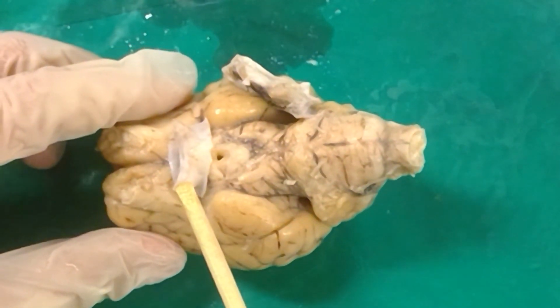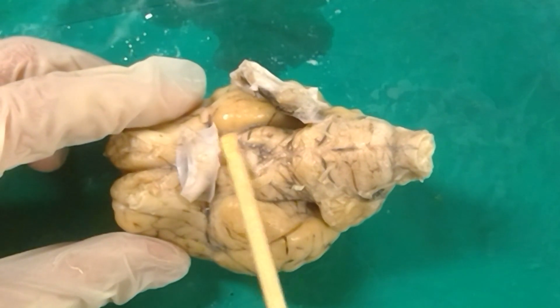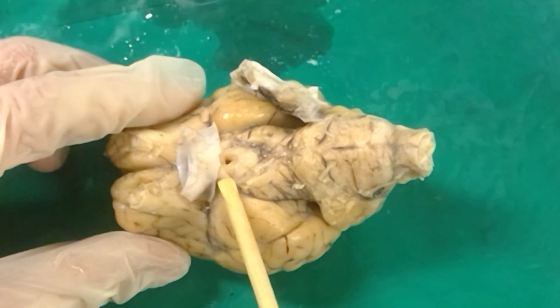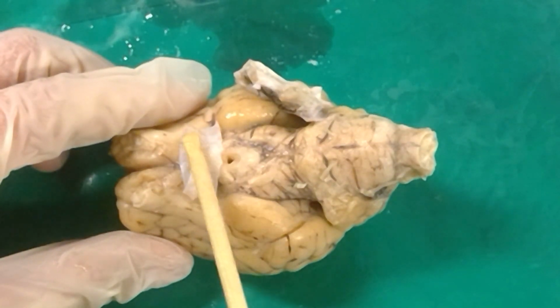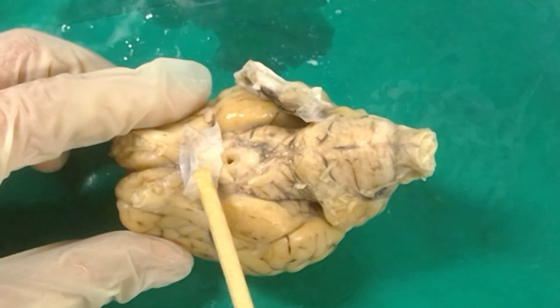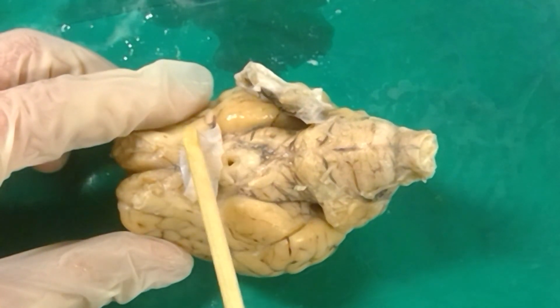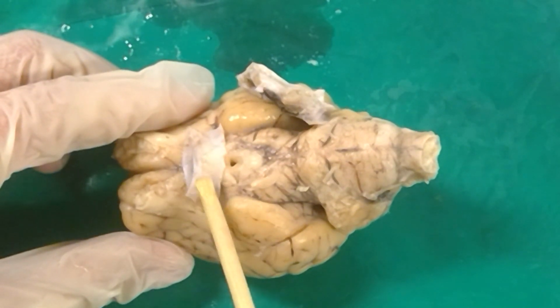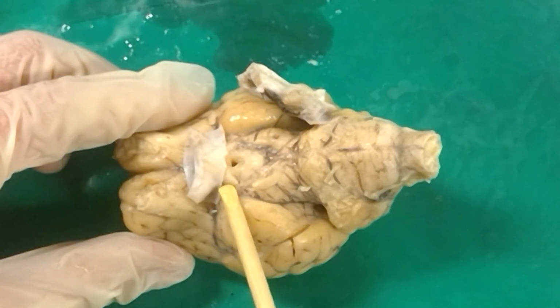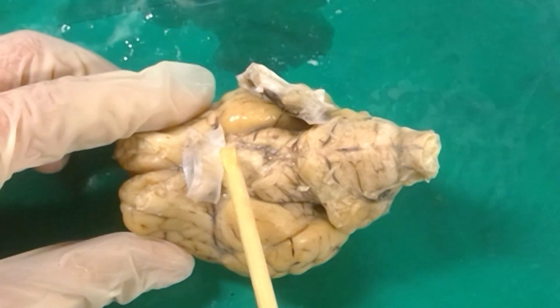But this optic nerve, some of these fibers will cross over to the other side of the brain right here at the optic chiasm. So chi in Latin means X, and that's kind of what we have happening right here. It's this crossing of fibers at the optic chiasm. So we have the optic nerve here on this side. It'll go through the optic chiasm, these fibers, and then on the other side of this is known as the optic tract.